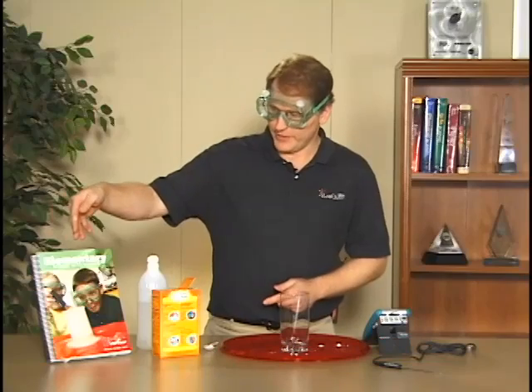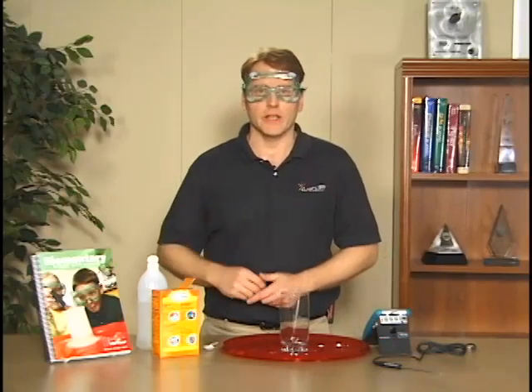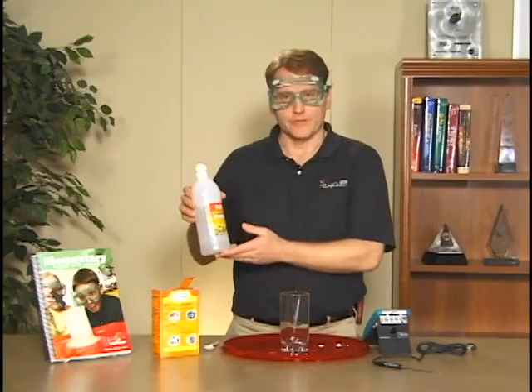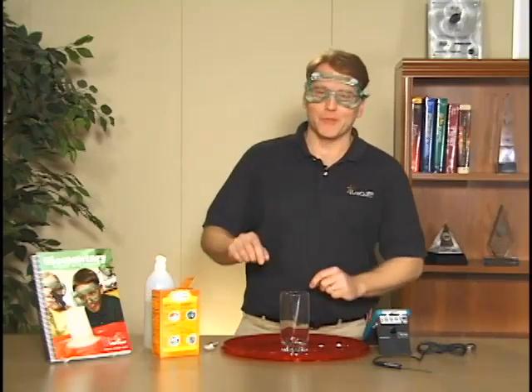Today I'm going to do experiment number five from the elementary Vernier manual, and it is the cool reaction lab. In that lab we have some vinegar and some baking soda, and we're going to mix them together.